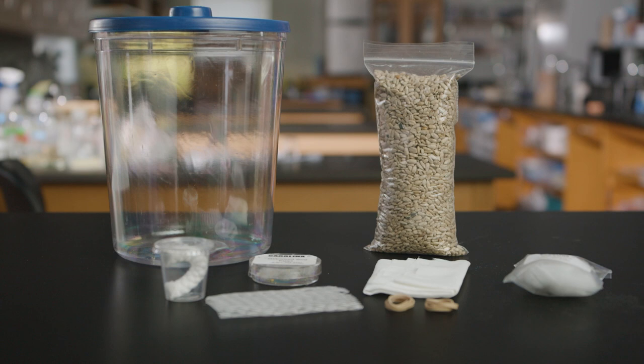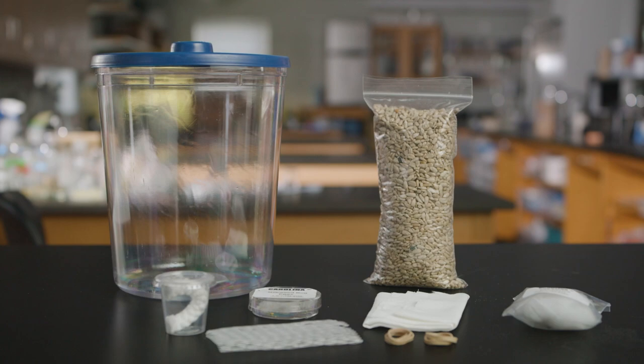To prepare for hatching, set up your culture vessel. You will need to provide your bugs with food, water, and shelter.